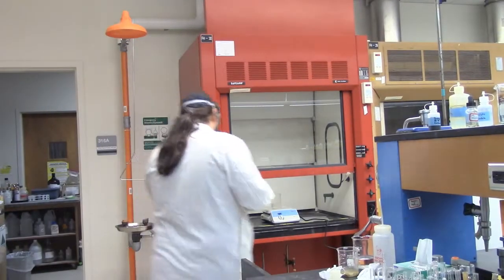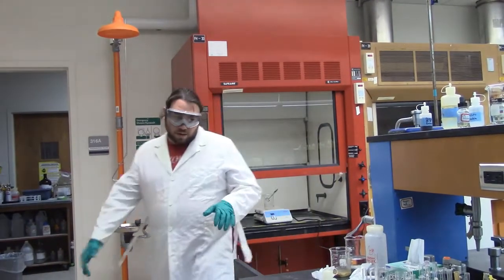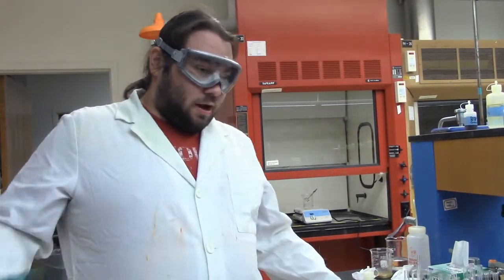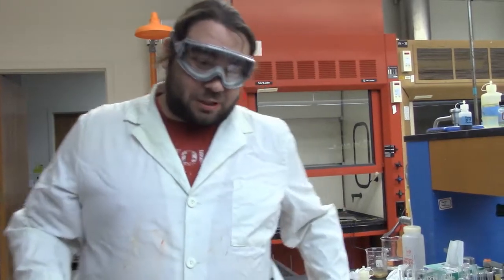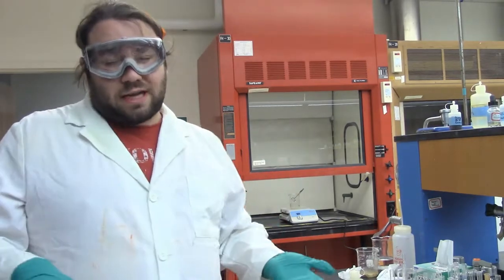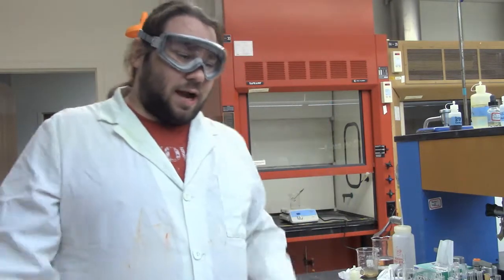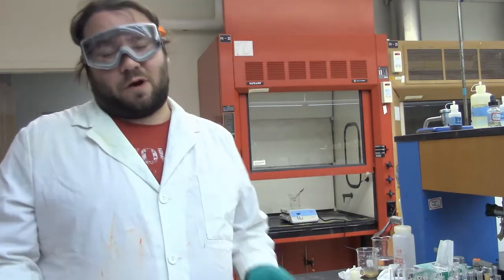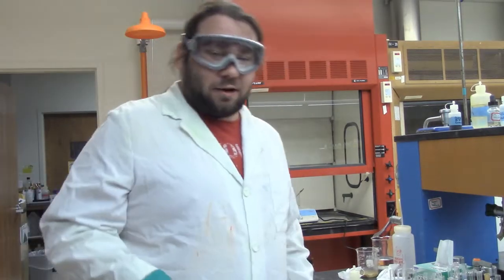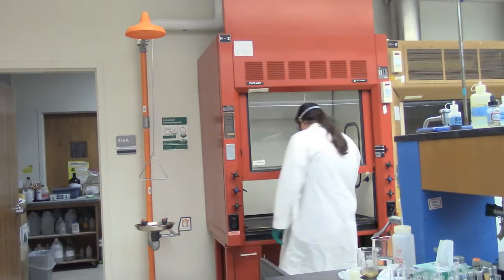And while I'm heating that, since it's only 30 seconds, we're not going to cut, but to pass the time I will mention that during our break, I did make a little bit of an error, and I accidentally threw out a whole bunch of the precipitate that we're supposed to use. So if we get to the barium and the calcium and something kind of looks like it's there, but maybe the color's a bit faint, go with your gut. I did accidentally throw out a bunch of our product that we should have had, and it is no longer there. That's on me. I'm sorry, guys. We won't take it out on you when we're grading this, though. So now that I've said that, it's probably been about 30 seconds.